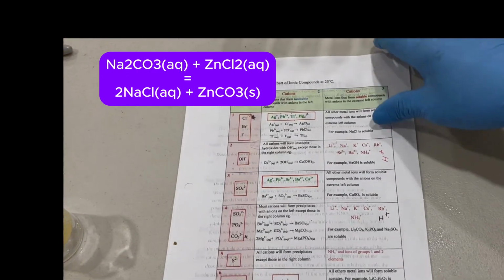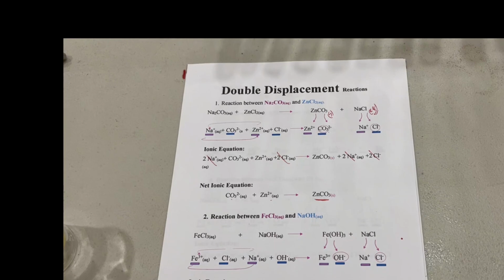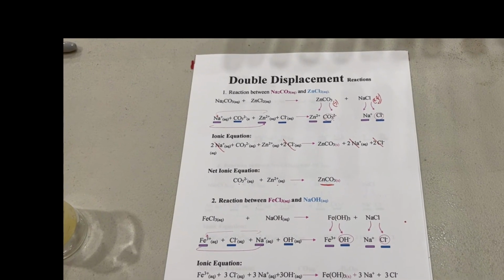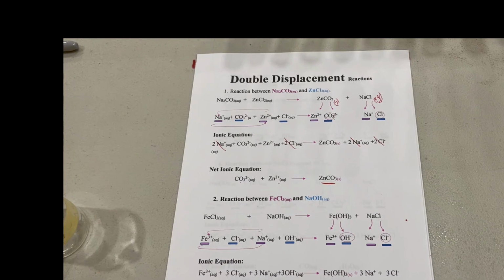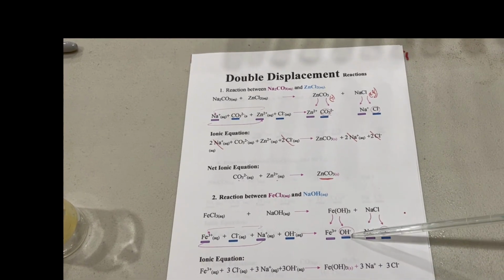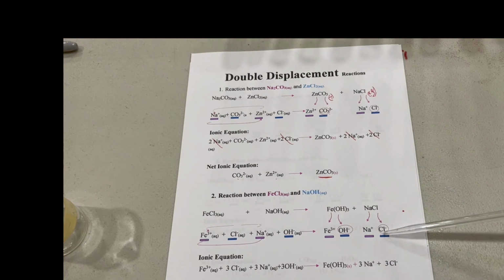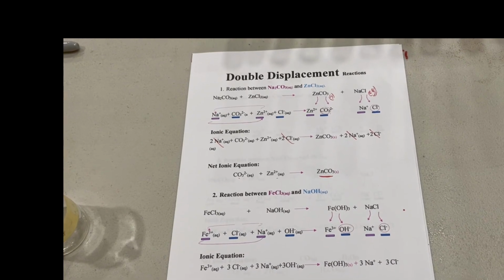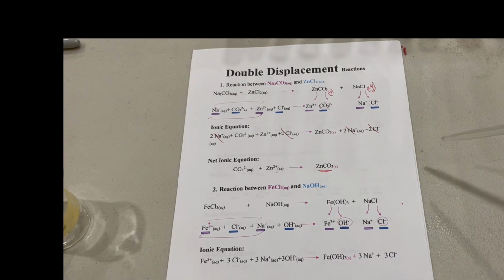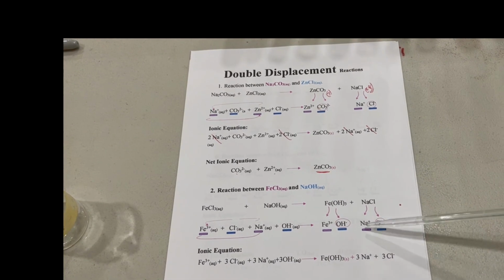Now the second reaction that we're doing has to do with the reaction between iron 3 chloride and sodium hydroxide. Like we did before, we'll do a double displacement. Now we have OH and iron, and we have sodium and chloride. Now, let's check the solubilities of sodium chloride. So we're looking at this anion here, that cation.